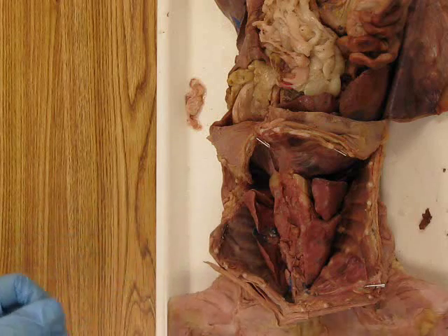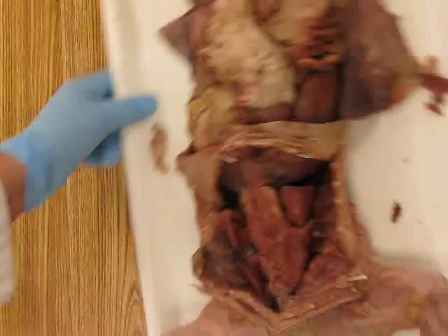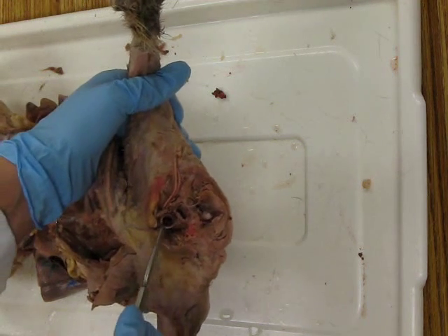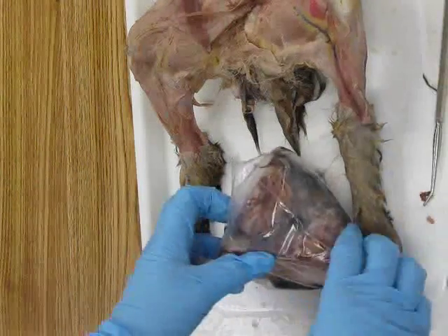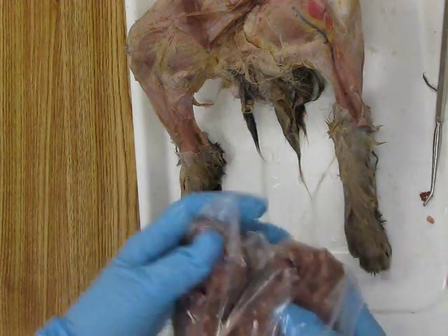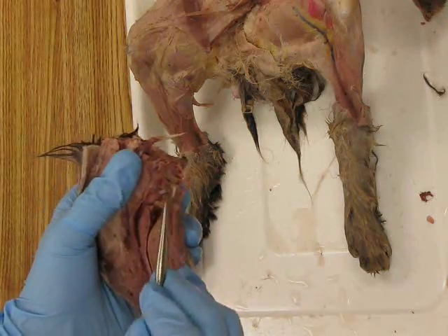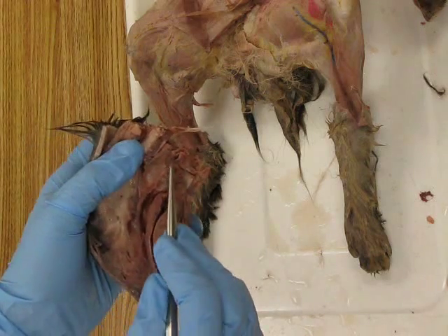Okay, we're also going to be identifying the trachea and the larynx, which you've actually already done during your previous dissections. So on these cats where the head has been removed, you know that you have your tubes. The anterior tube or ventral tube on the body is going to be your trachea. Behind that was esophagus. We also identified these structures in the sagittal cat head. So, the ventral or anterior portion is the larynx or voice box. It's cartilage, it's harder tissue, and then behind that was esophagus.